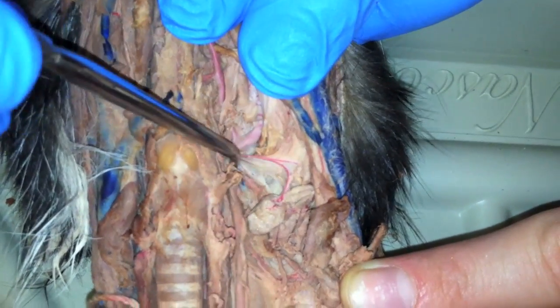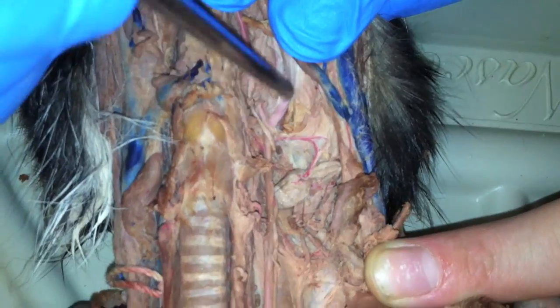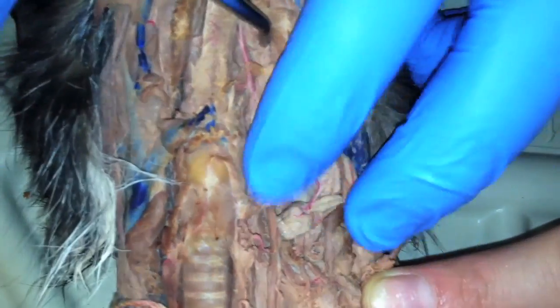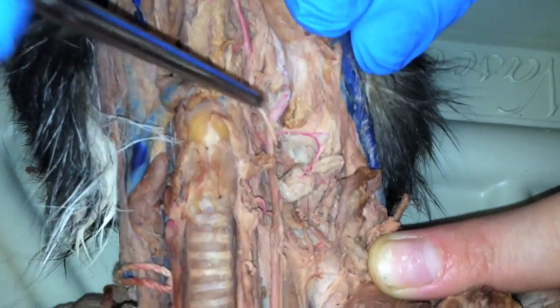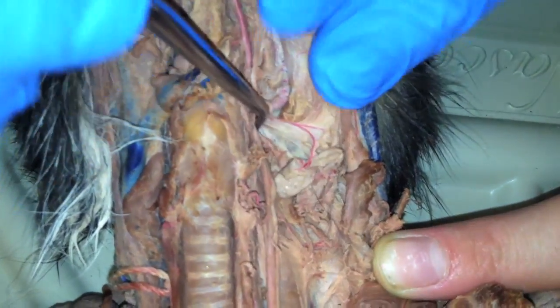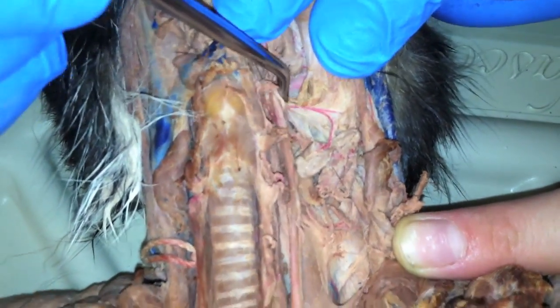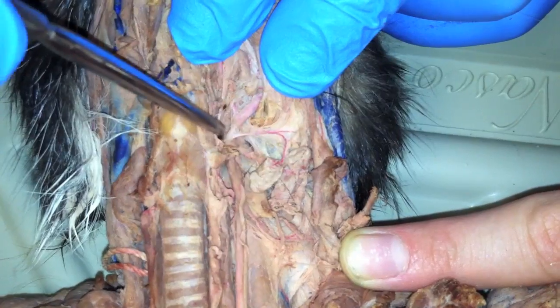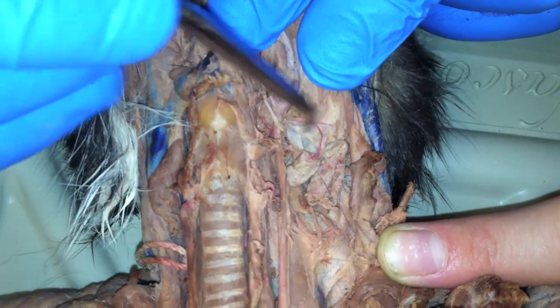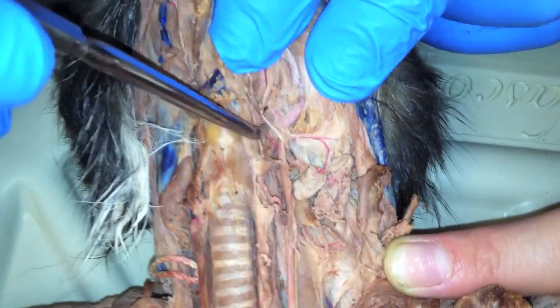And the internal's that pink right there. Internal, external, and lingual. Can you point out the internal again? So we got those.